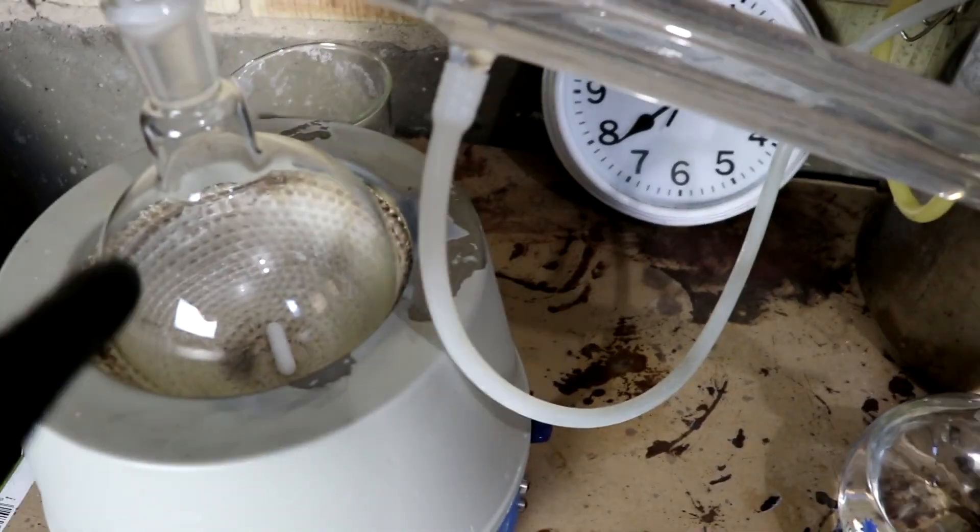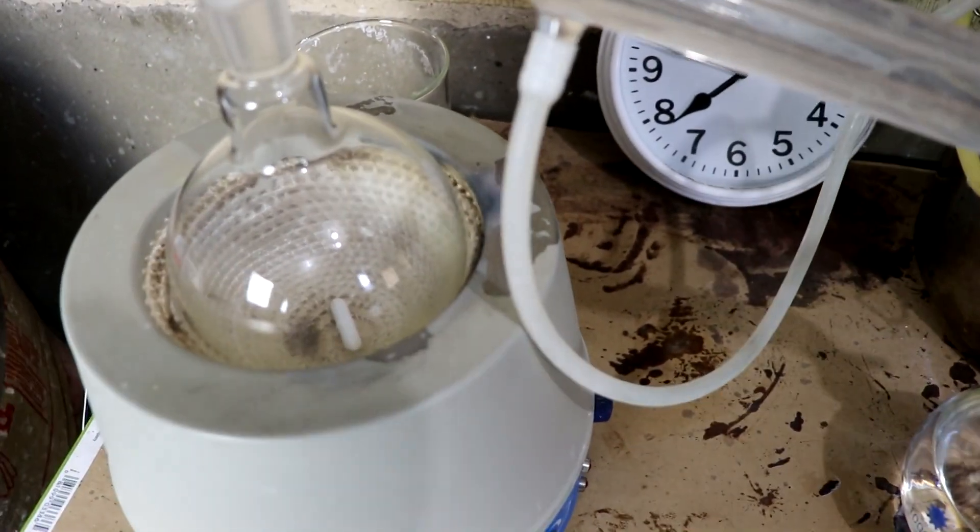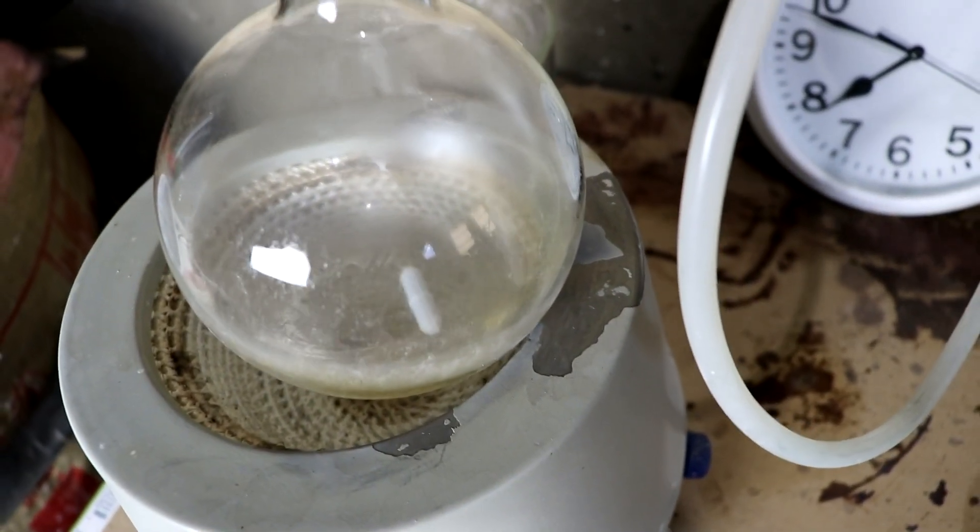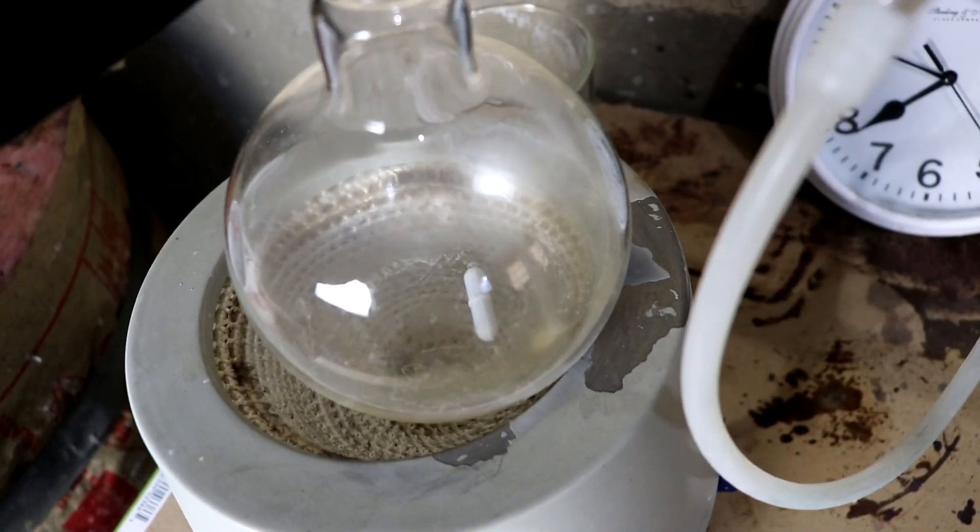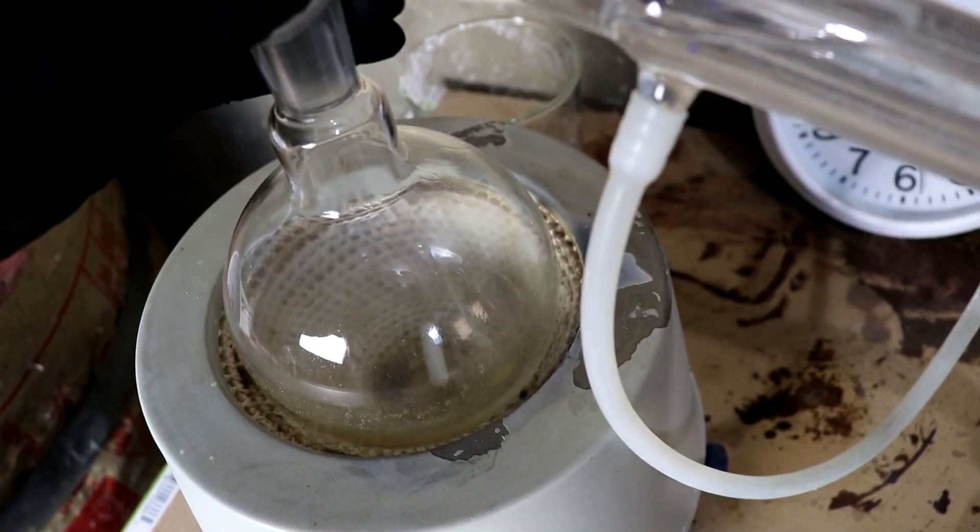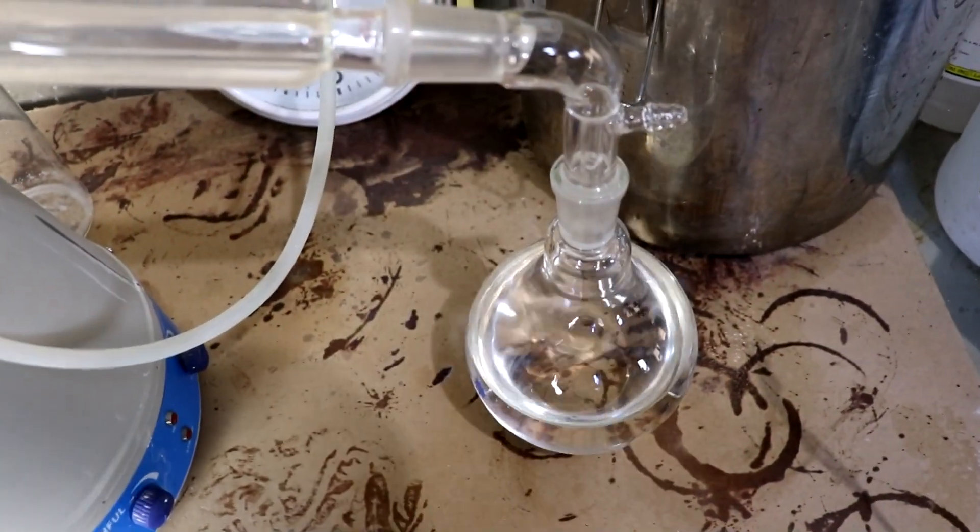I've transferred all of the acetone over. Hopefully all my iodine has stayed. Oh yeah, there's a little bit of crusty white stuff in there. As I'd expect. Not very much, though. So good. Well, let's run this through some more salt, then. It is boiled dry.